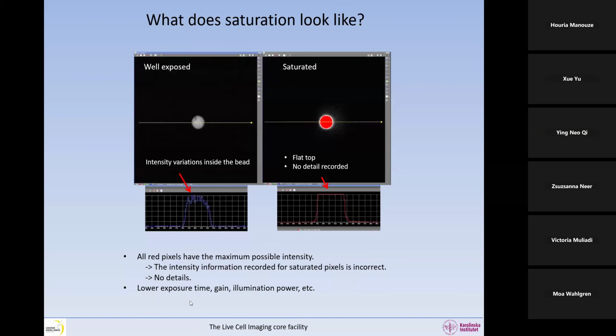So what we need to do is basically lower the amount of photons that go to the detector because we are saturating it. So we need to lower the exposure time, lower the gain, or lower the illumination power, for example. And you need to be specifically careful when you do a Z stack, because if you set everything for one Z, you might actually have a higher intensity at a different Z, and anyway, you end up with saturation. So in a Z stack, you need to do a quick check through the Z to try to find the brightest area in the sample in XYZ, and then you set your settings for that, or you're a little bit conservative, and you don't go close to the maximum when you set.